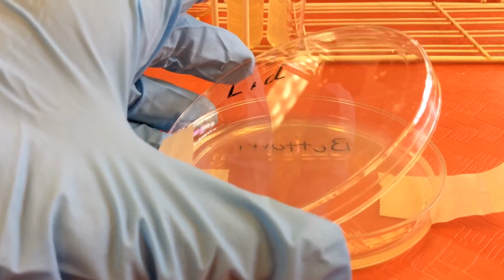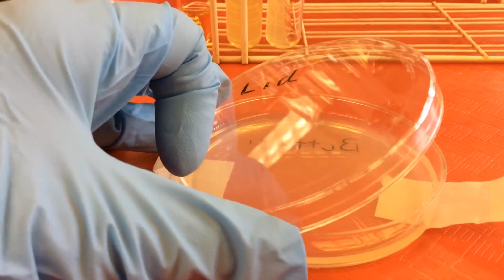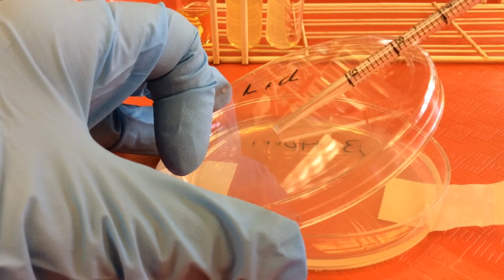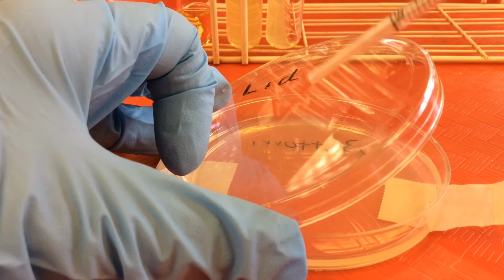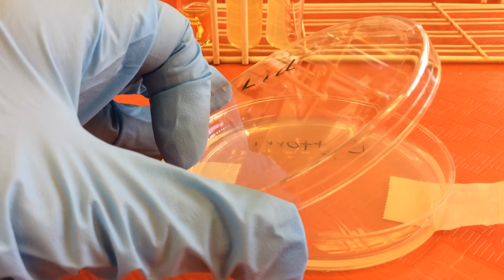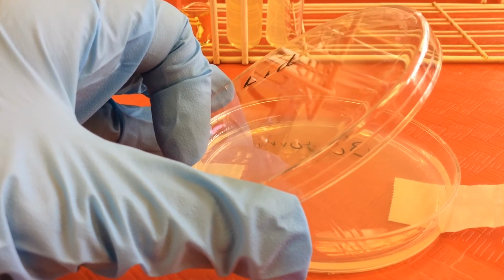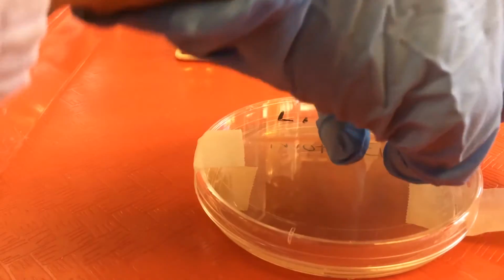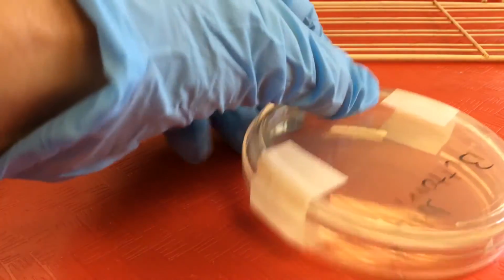So to prevent contamination with airborne microbes, we always open our plates like a clamshell. And what we're hoping is, as airborne microbes fall, they're going to hit that lid and will reduce the chance of contamination of the surface of our agar. We'll transfer the microbes we want to grow to the surface of the agar plate. Then we're going to close it, tape it shut, and very importantly, when we incubate, we always want to invert the plates. And invert means we're going to turn them upside down, right? So the bottom would be facing up.